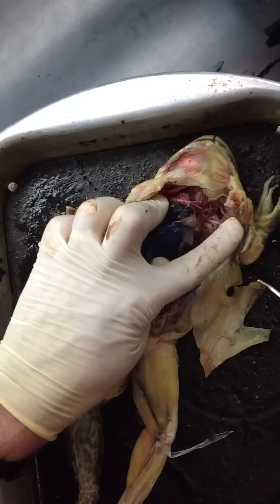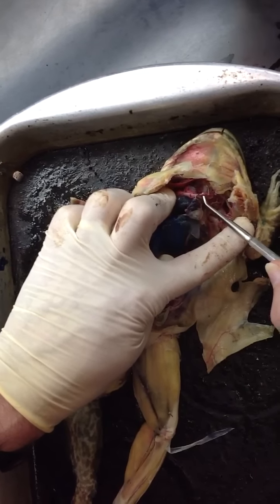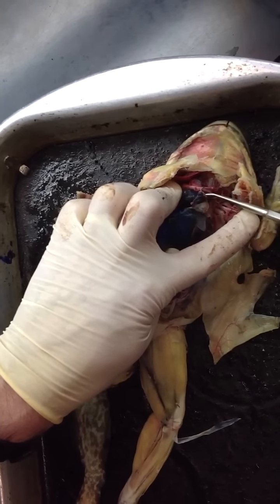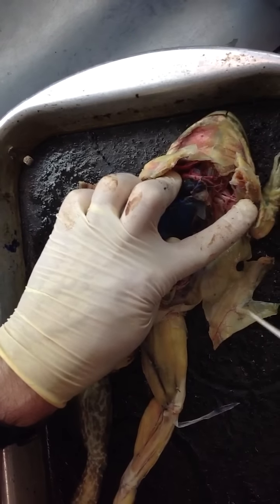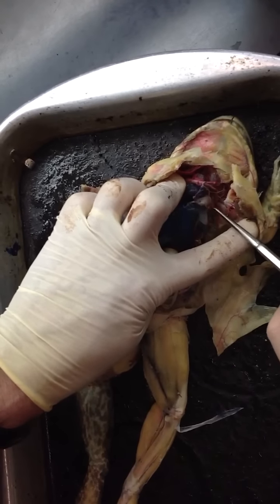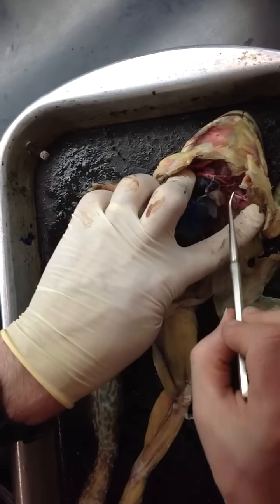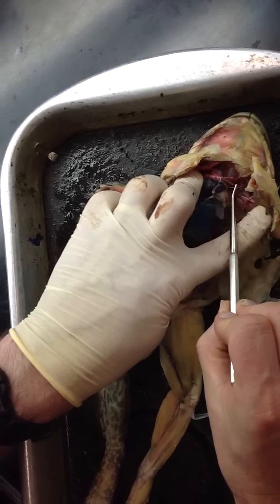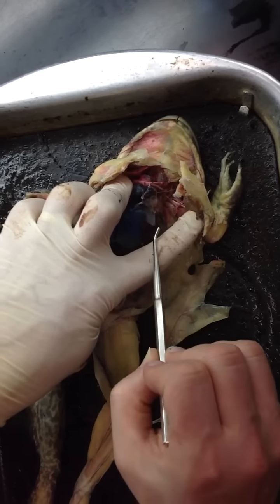And let's see if hopefully my fingers are not in the way. They include the carotid arch here, most anterior, the systemic arch right in the middle, and then the pulmocutaneous arch, which is most posterior. The pulmocutaneous arch has two branches. One, the pulmonary artery here, which leads to a lung. Oops, the lung's a little bit further down here, sorry. And then one that's very skinny and almost broken here, and that is the cutaneous artery leading to the skin.